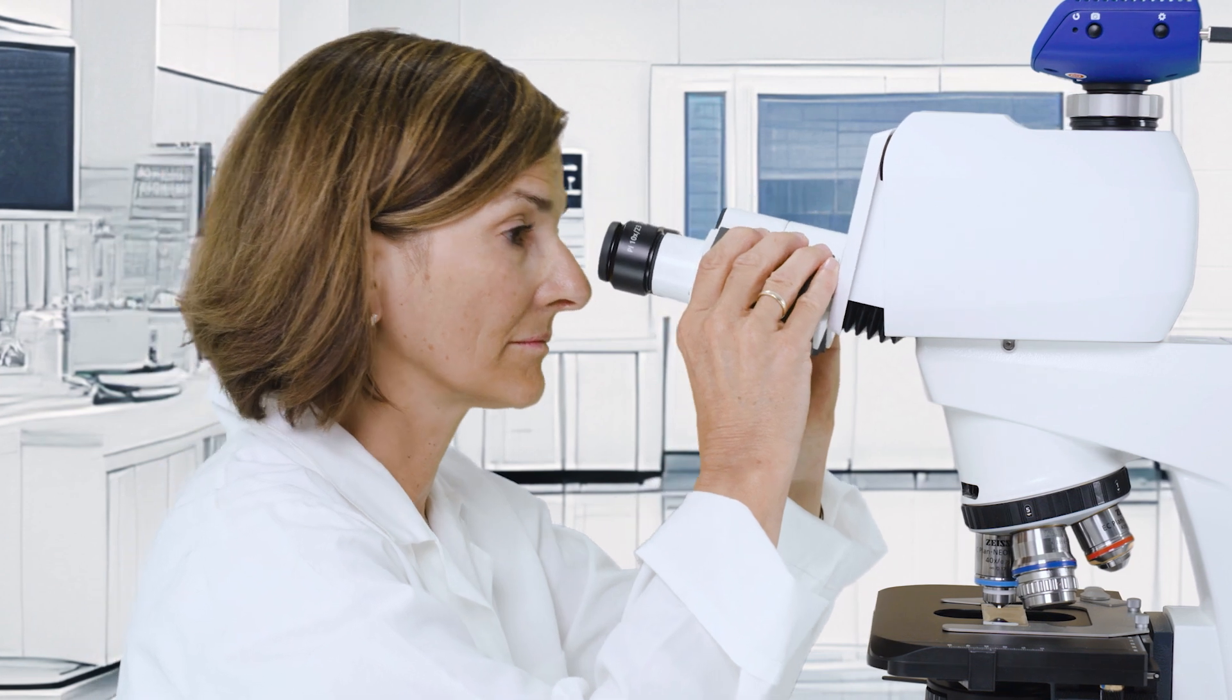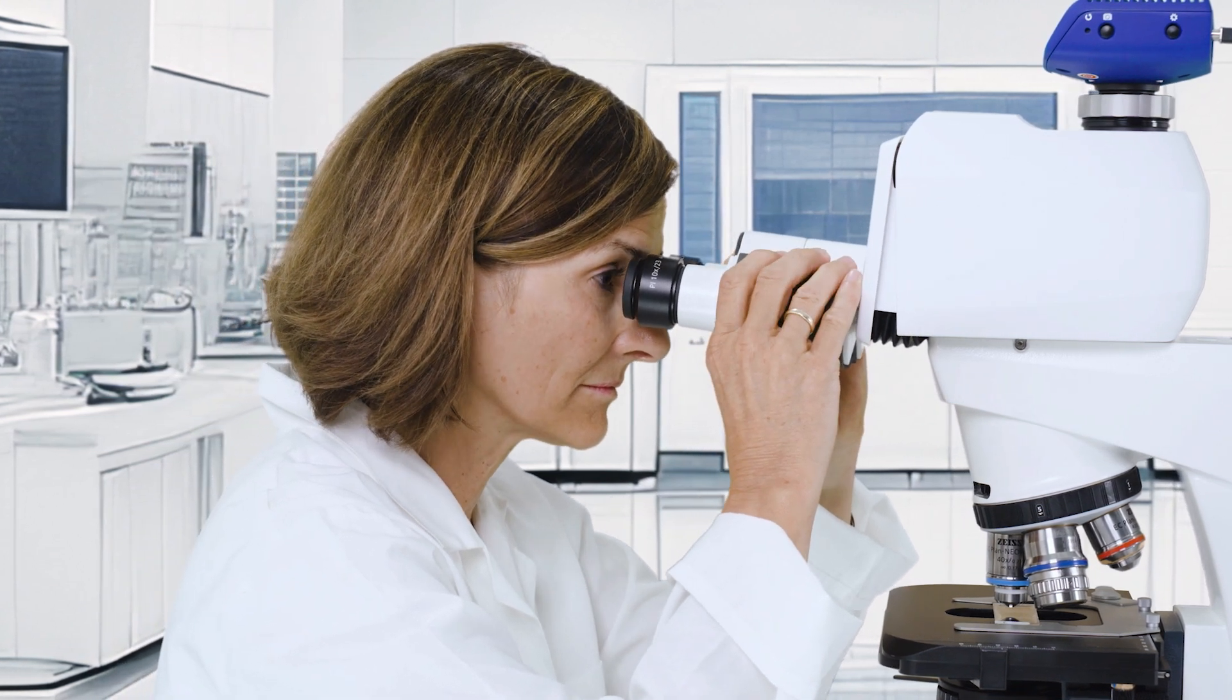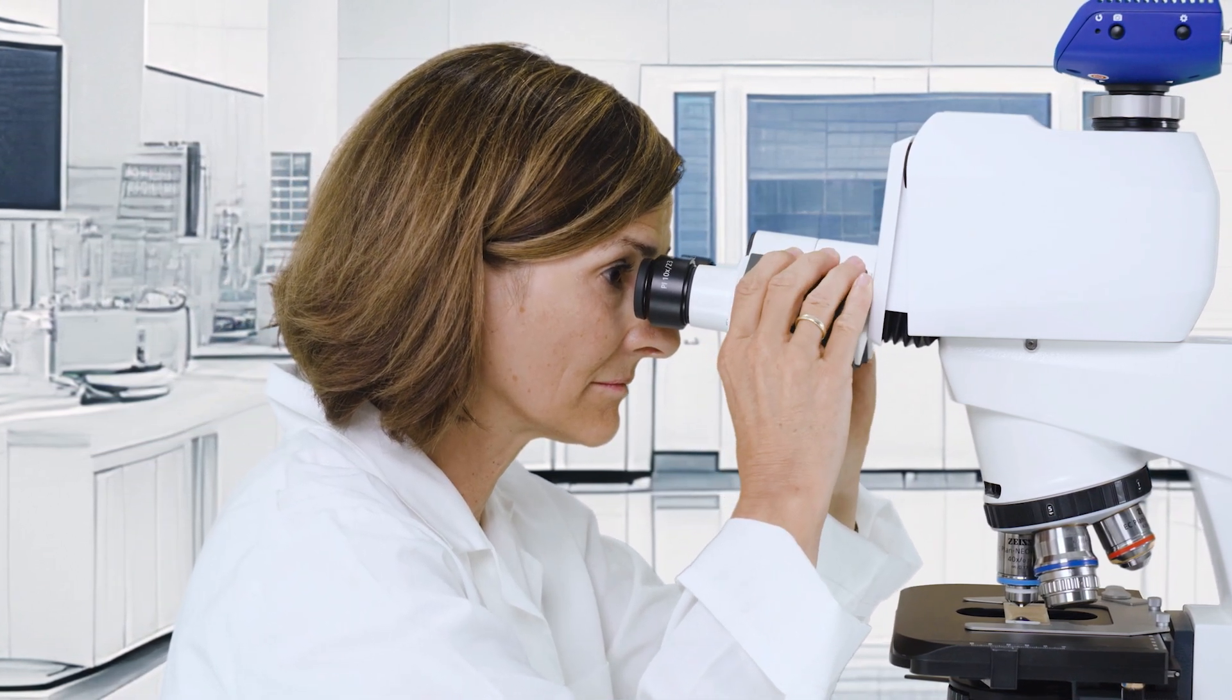Now adjust the angle of the microscope tube for a rather straight view into the eyepieces. This step is crucial for preventing neck and back strain.